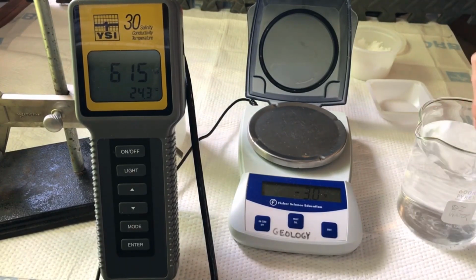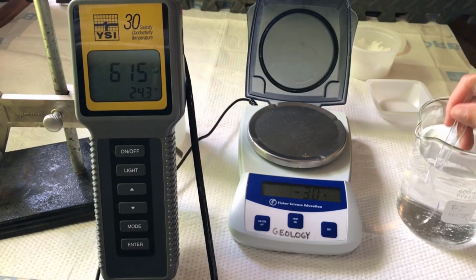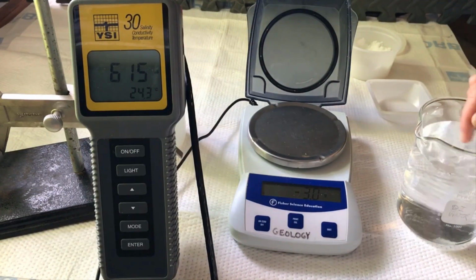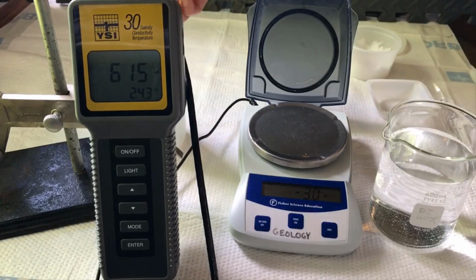We're going to stir each of our solutions to try and encourage the salt to dissolve or go into solution. You can take this time to think about what is actually happening on the molecular scale to each of the salt crystals. What's happening to the individual sodium and chloride ions as the salt dissolves into the water. Okay, didn't get all the salt dissolved, but I got the majority of it dissolved.